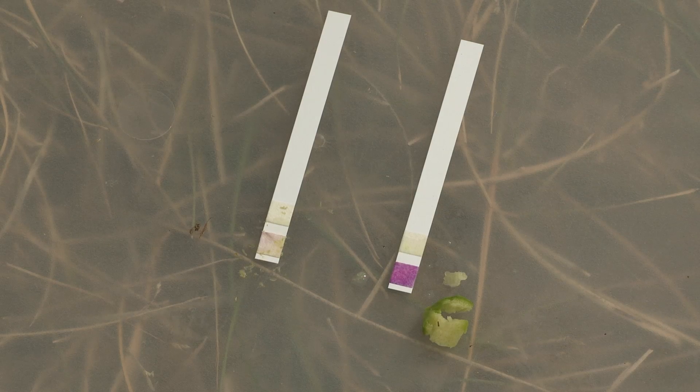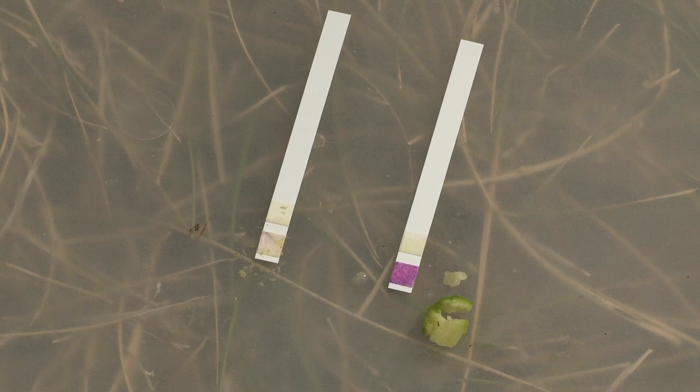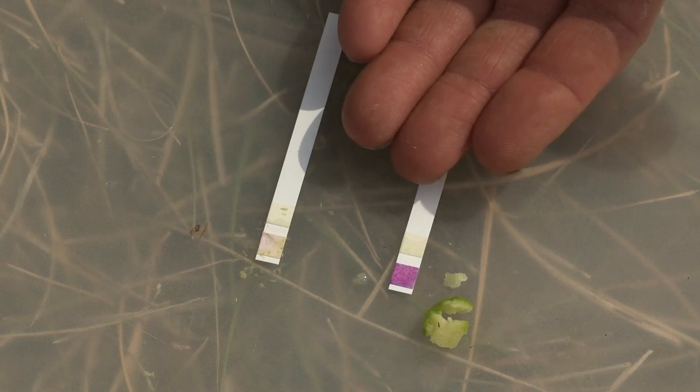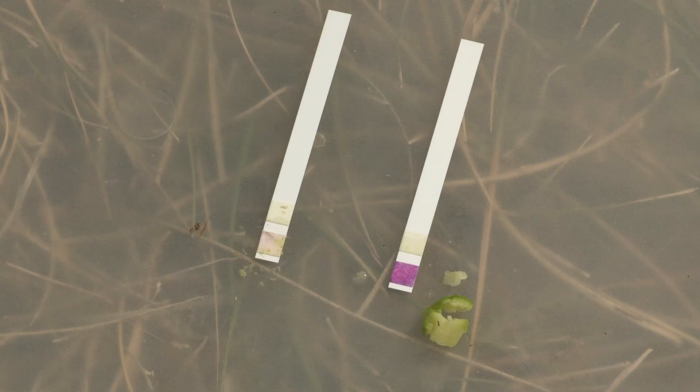This is a simple, quick test that is very useful for county agents to go out there and do a quick test on fields. The ones that are at a danger level, then those can be taken to the lab for further testing.